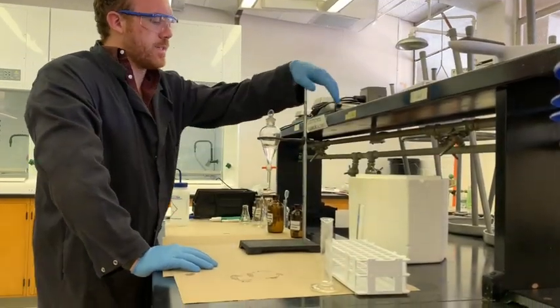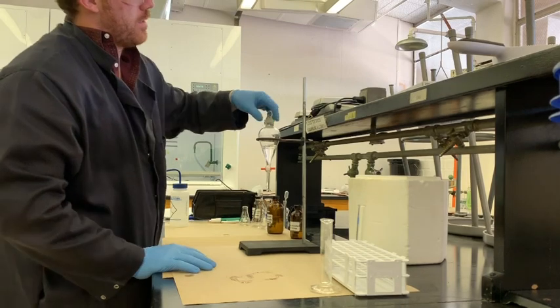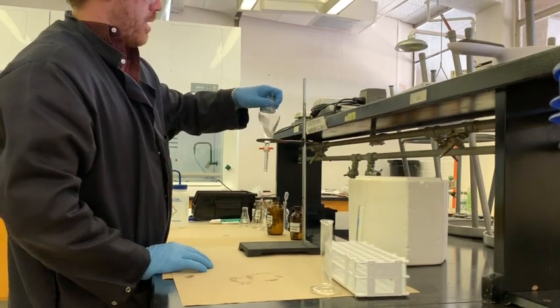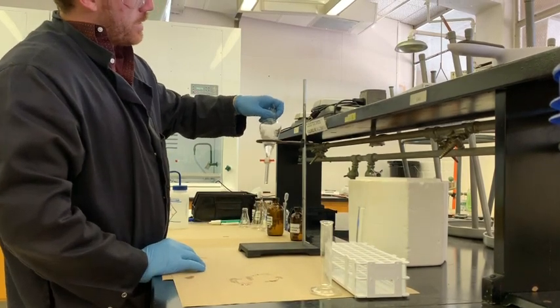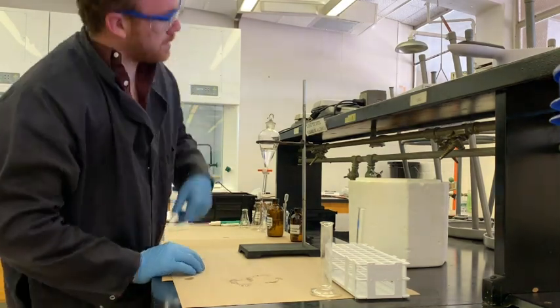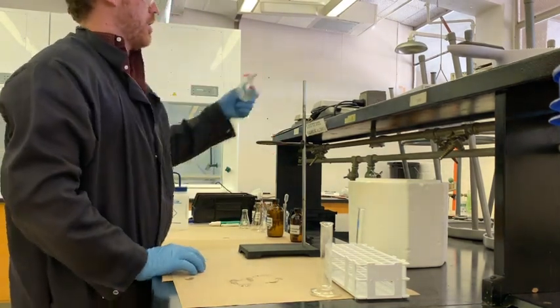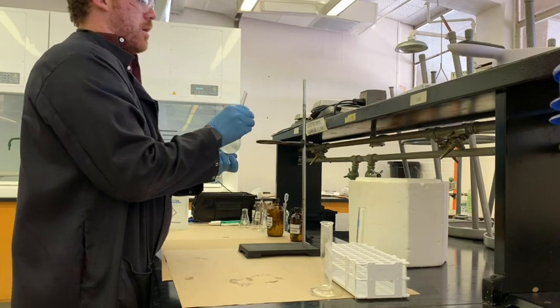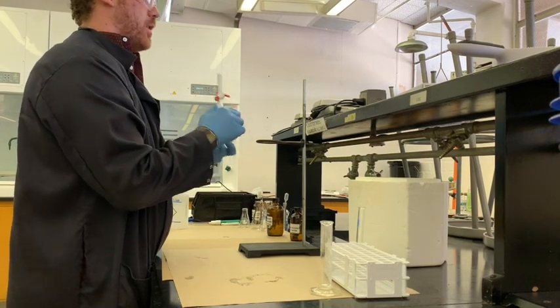All right well it's been 10 minutes and there's not a lot of activity. It's pretty quiet on the front here in this mixture. It seems to form a small layer so I'm going to give this another shake real quick. Just to make sure everything is fully reactive.